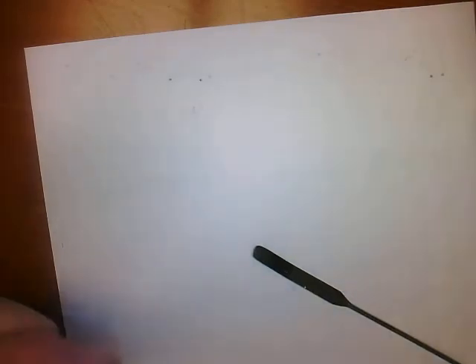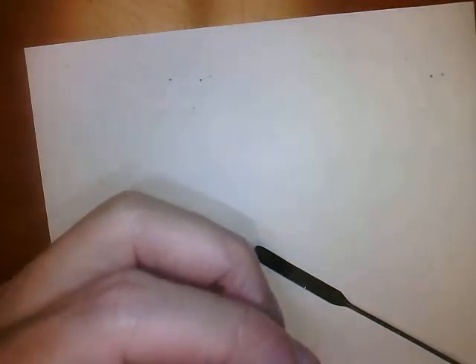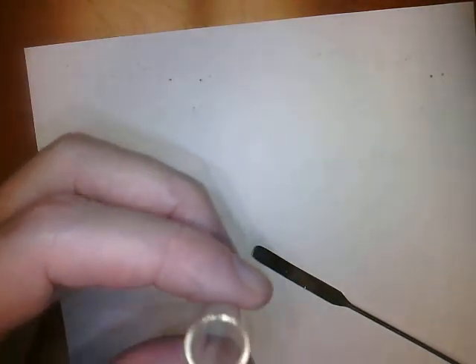Alright, so one more thing that I want to look at real quick, that I realize I skipped over, and that is copper being mixed with ferrocyanide. We're going to go back to copper for just a second. We're going to put the copper in the tube, and we're going to add ferrocyanide. Here we go. Alright.